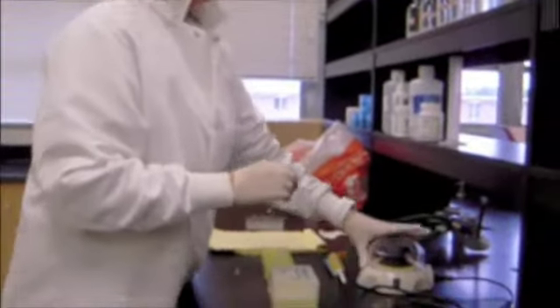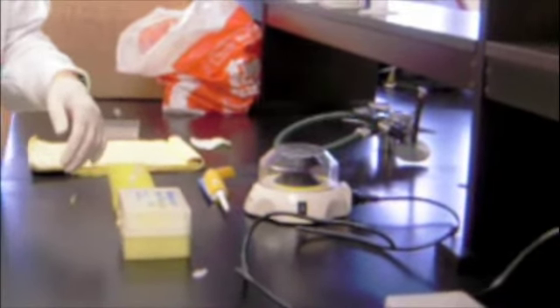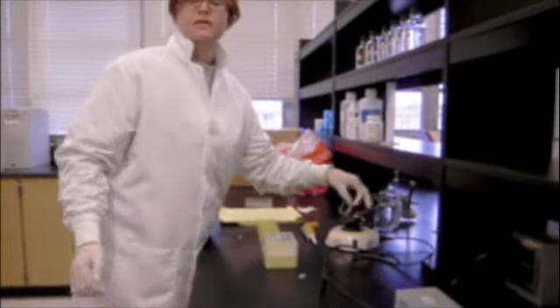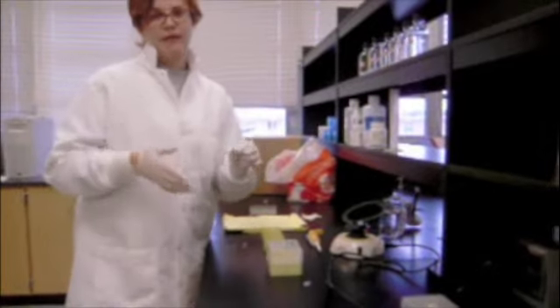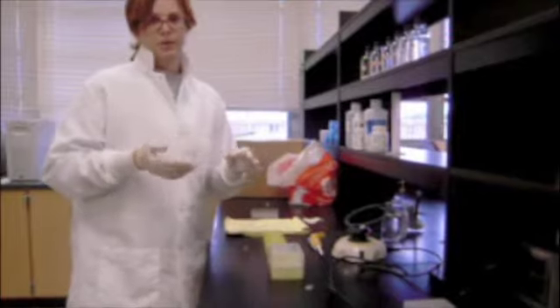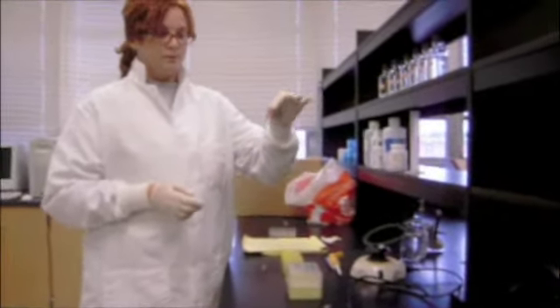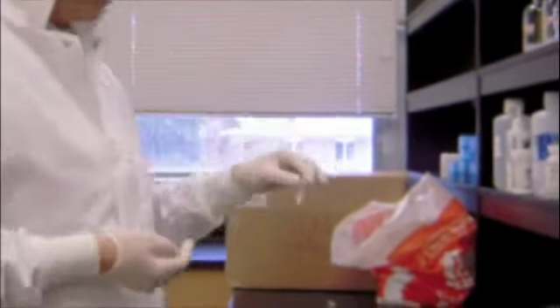Then I'm going to spin it down with the centrifuge to break open the cells. The reason why I want to break open the cells is because the DNA and the RNA is contained in the nucleus, and the proteins are contained within the plasma membrane of the cell. So by spinning it, I break open each of those membranes. So I bring it out and I have a pinkish mixture. Remember, this is trireagent and cheek cells and 70% alcohol.